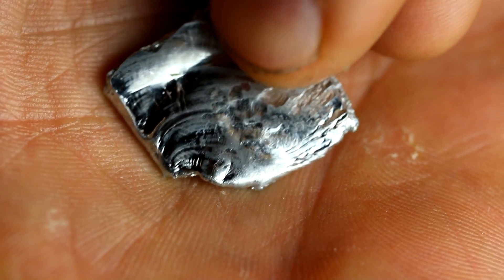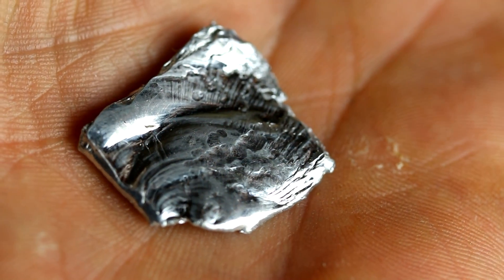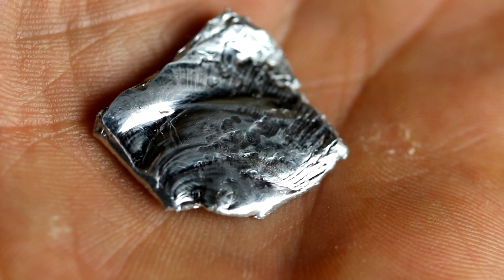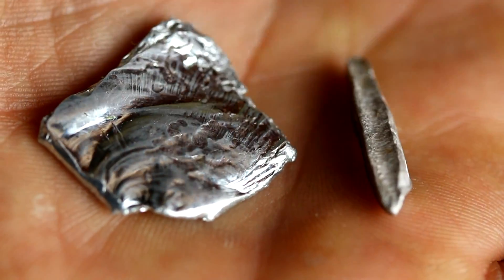Hi there everyone, welcome back to Cody's lab. So this is a shard of gallium metal and this here is a piece of indium metal.